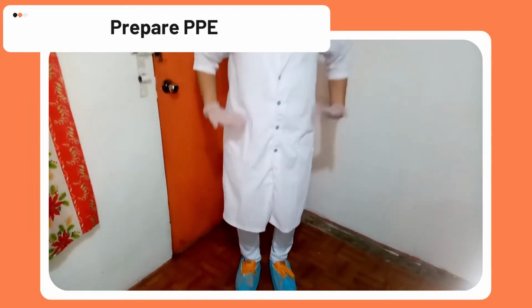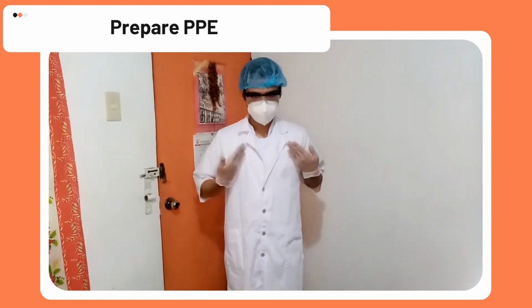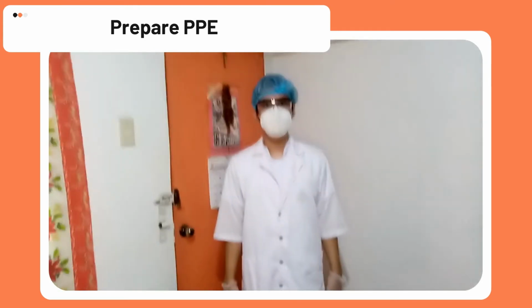Step 3 is to prepare the PPE: your shoe covers, lab gowns, gloves, face mask, face shield, and hair cover. This is to protect you from the spill and chemical splashes.